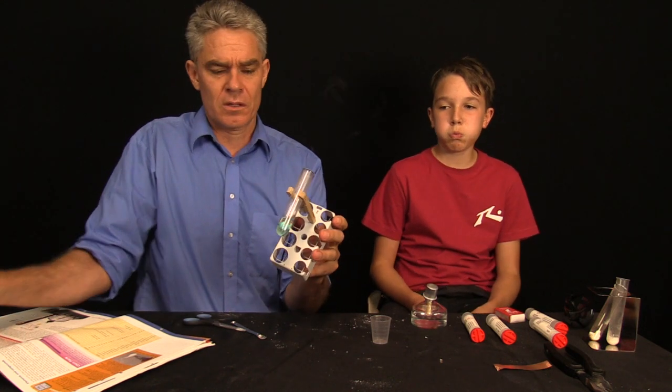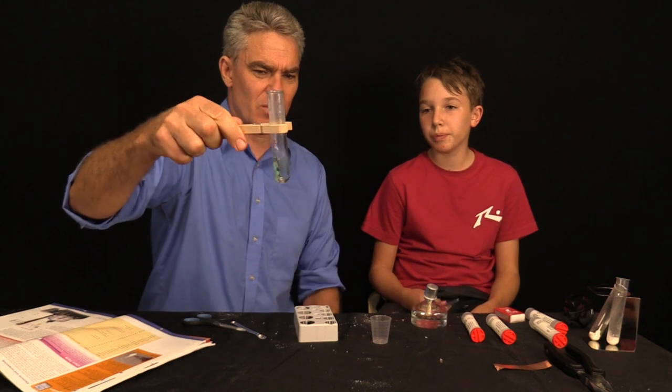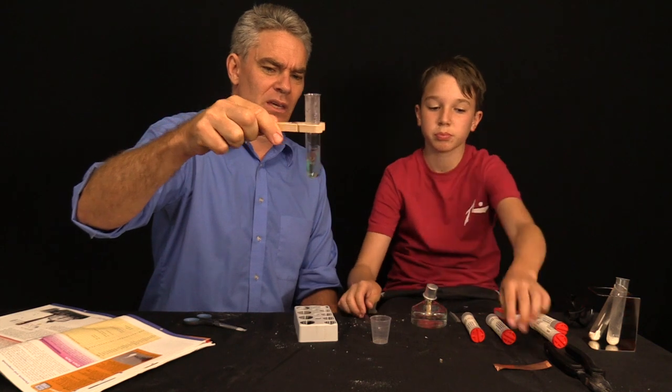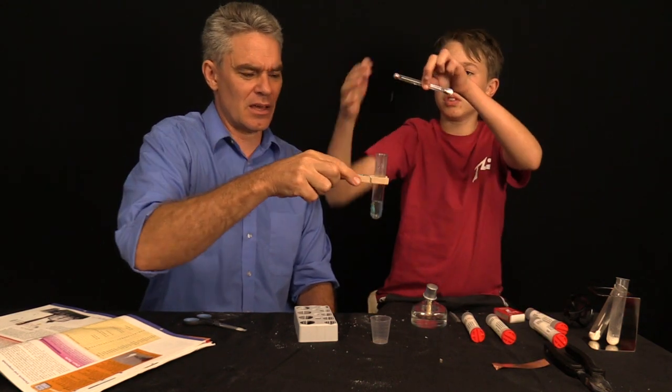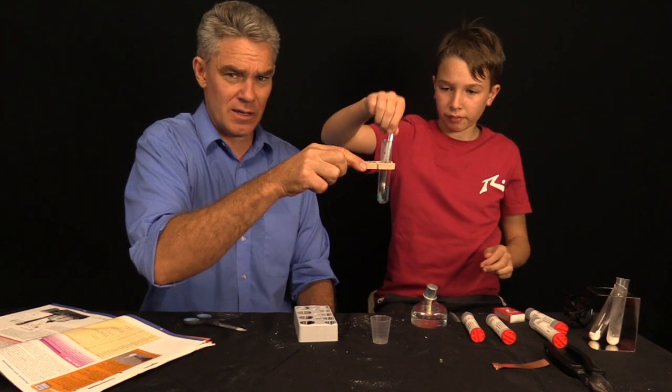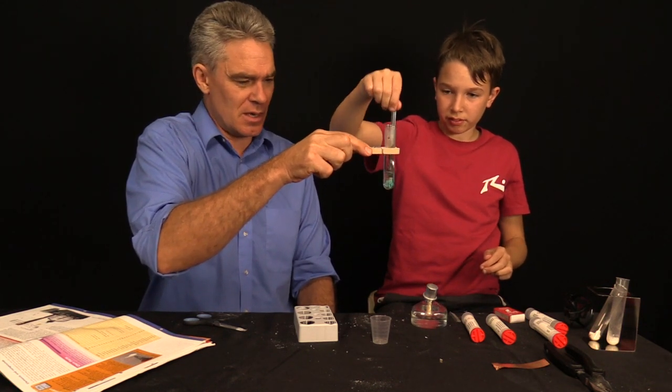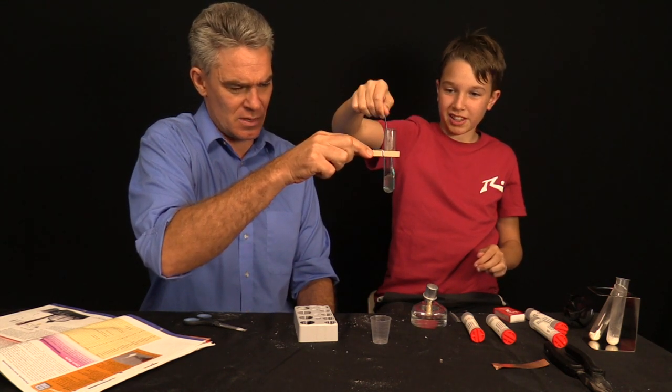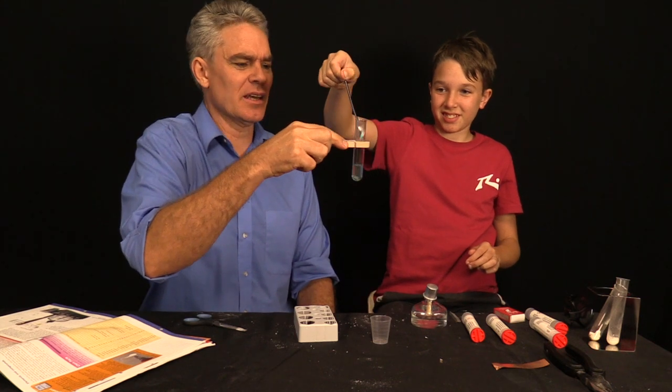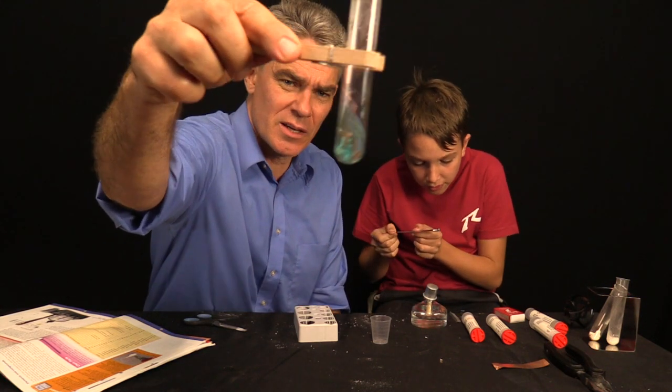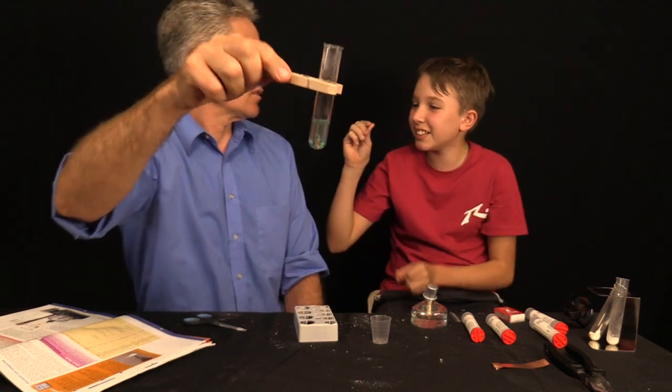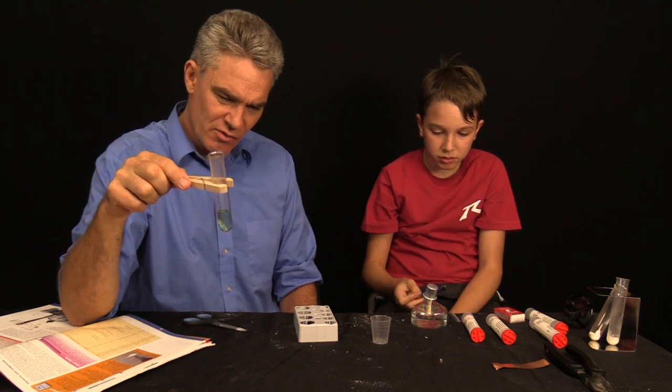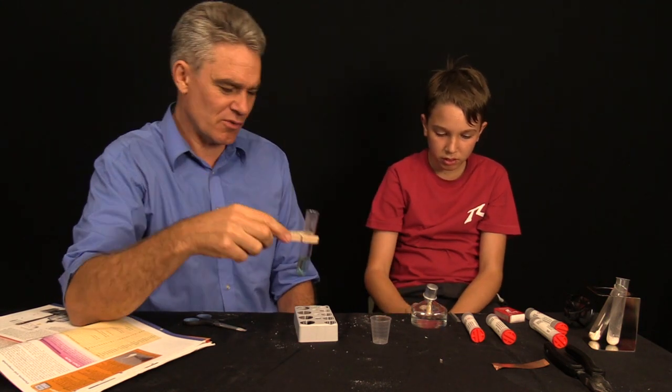I think it will be alright. So, I'll take it out. And we'll give it a mix like this. You can give it a mix with the spoon. And maybe some of that copper sulfate will dissolve. Are we getting any dissolving happening there? Of copper sulfate? I think so. We're going to leave it in there. I got some copper sulfate. You got some copper sulfate crystals. Very very good. Tiny little blue. But I'll let that just dissolve overnight to get some more copper sulfate.